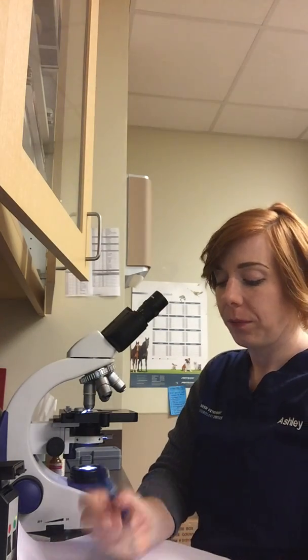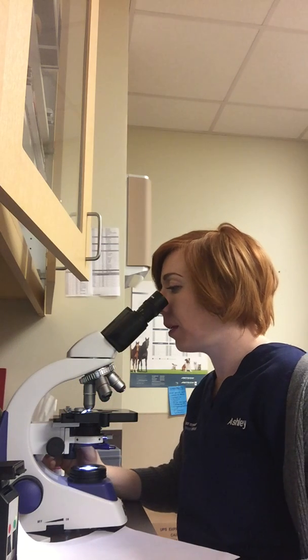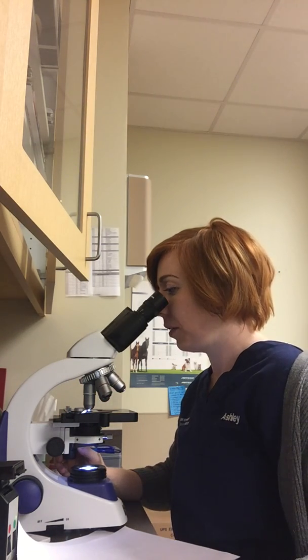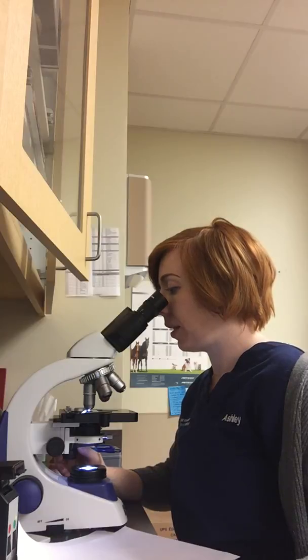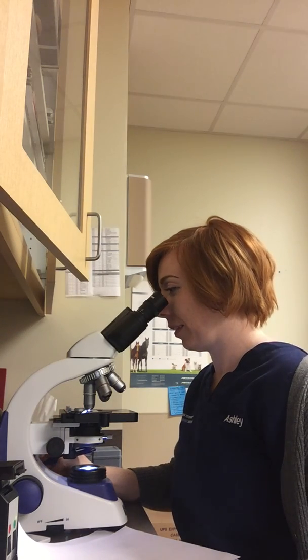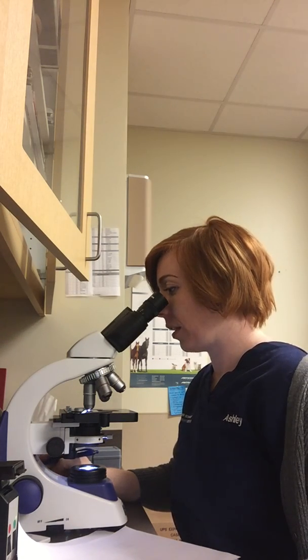Nine. So I'm seeing some monocytes, and they're obviously the bigger ones that have the pinker nuclei shaped like a kidney bean, and then you see the lymphocytes that are a lot smaller. The nucleus is very round and takes up the majority of the cytoplasm. It's also stained really dark purple.